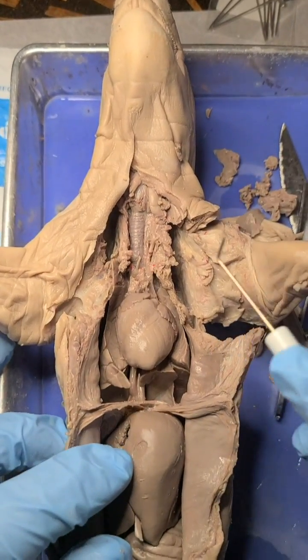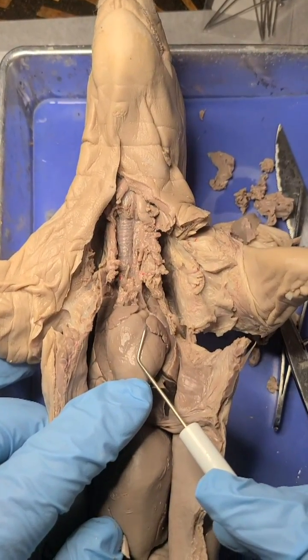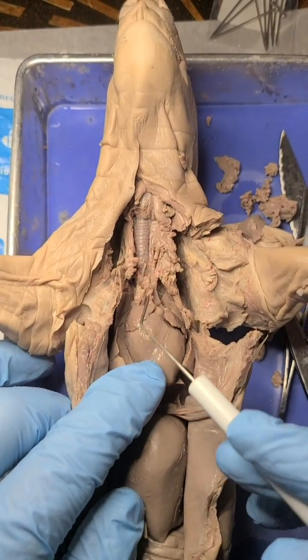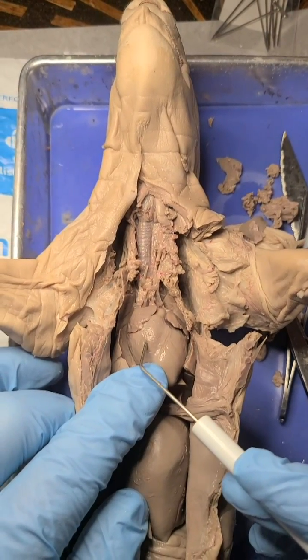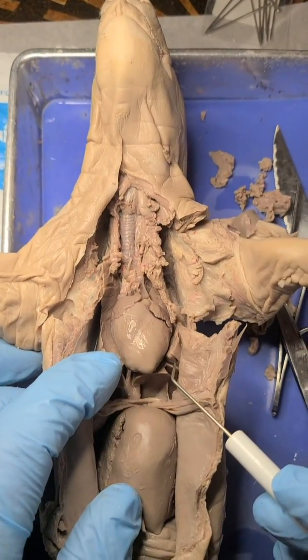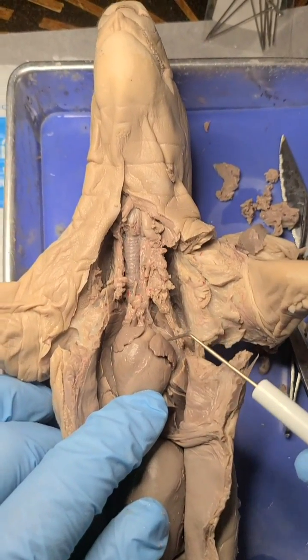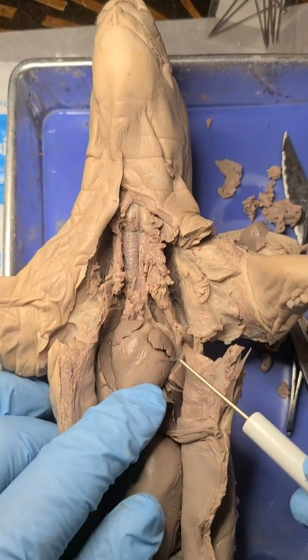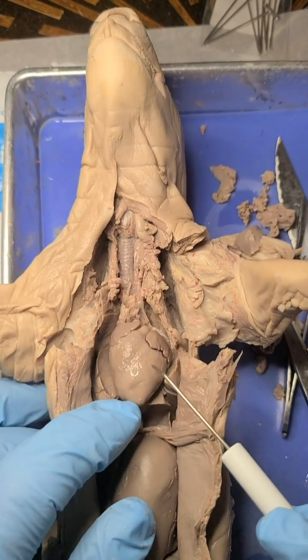The circulatory system — the heart is the key pump. The heart is going to receive blood from the body on the right side of the heart. Here's the right atrium, and then the right ventricle is going to pump that blood to the lungs to pick up oxygen, and then the blood will return to the left atrium, and then the left ventricle will pump the blood out around the body. So we have a dual circulation system.